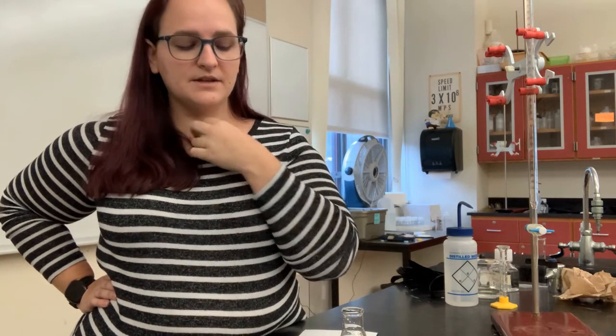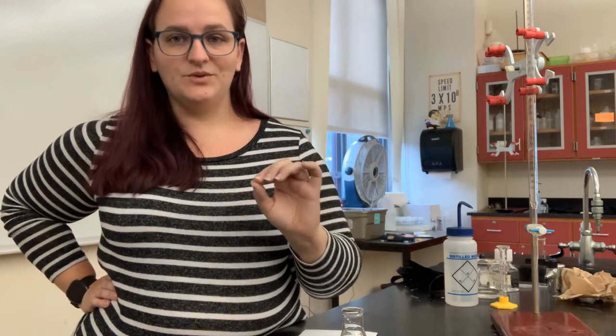When you're getting close to that is where you want to slow down the addition of the base into your flask to try and get down to 1 or 2 drops, knowing when that pink change actually happens. You want the palest pink color you can. The paler the better. If you have to ask, is this pink enough? It's probably perfect. The answer is yes. If you get too hot magenta, you have gone too far. Not a big deal for this lab, but just be aware that paler is better here.